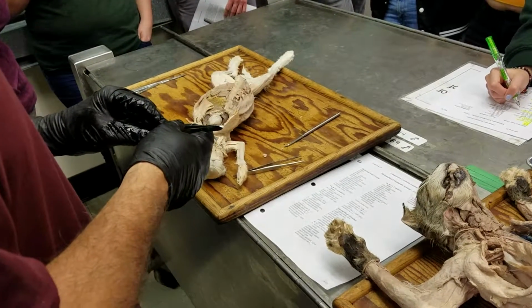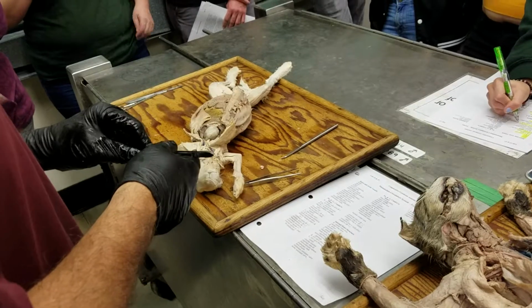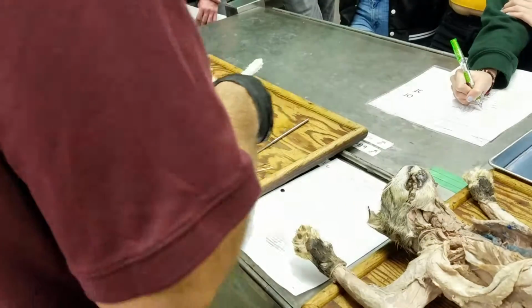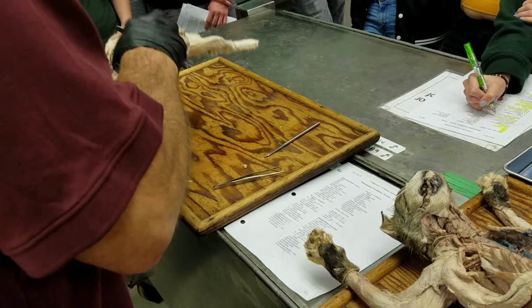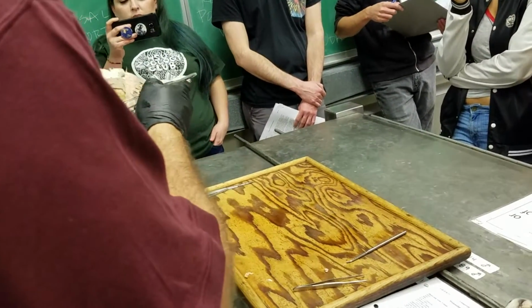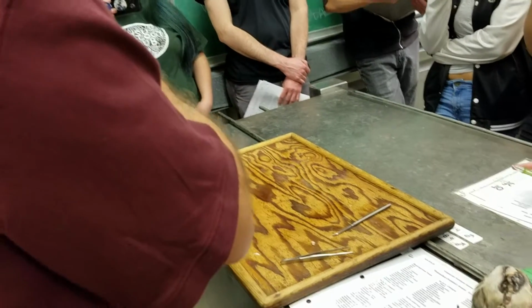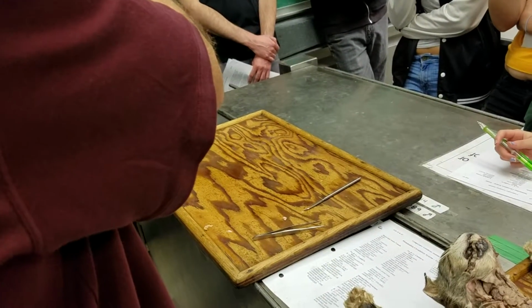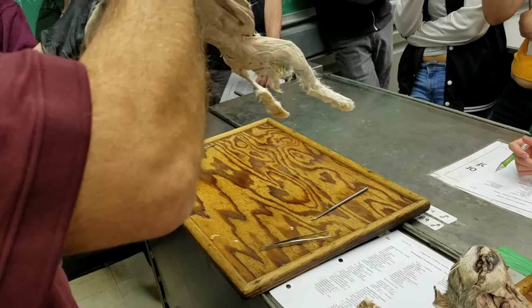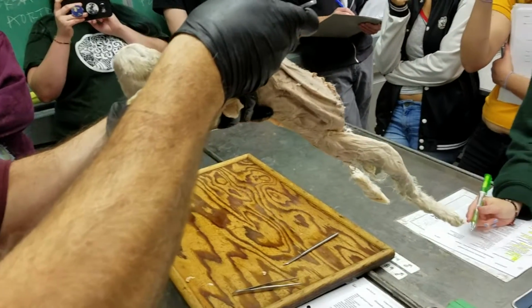For some reason on here I have coronary sinus at this point, and I think what the point is just that I wanted to show you how on the rabbit heart, if we look at the left cranial vena cava, you can see that it kind of runs across the backside of the heart over to the right atrium. So do you see that? This is actually probably easier to show you than most things.